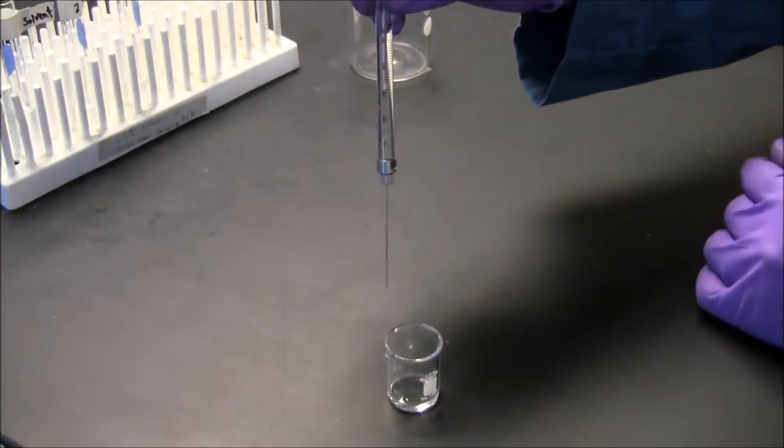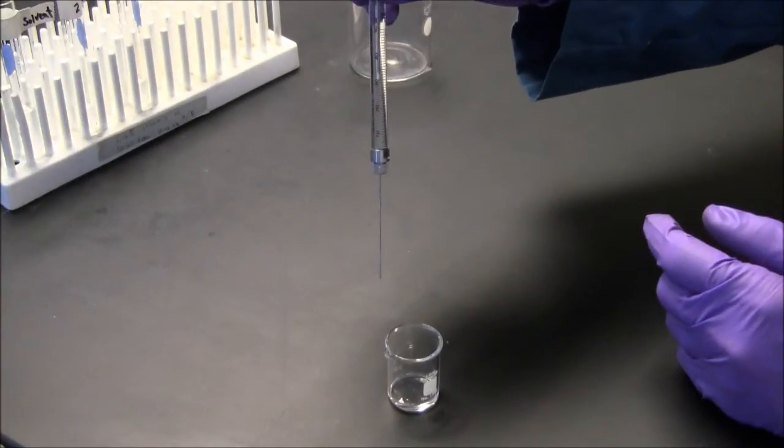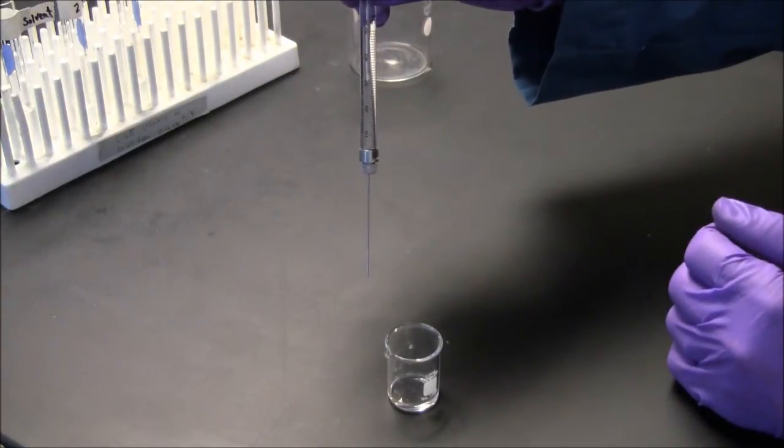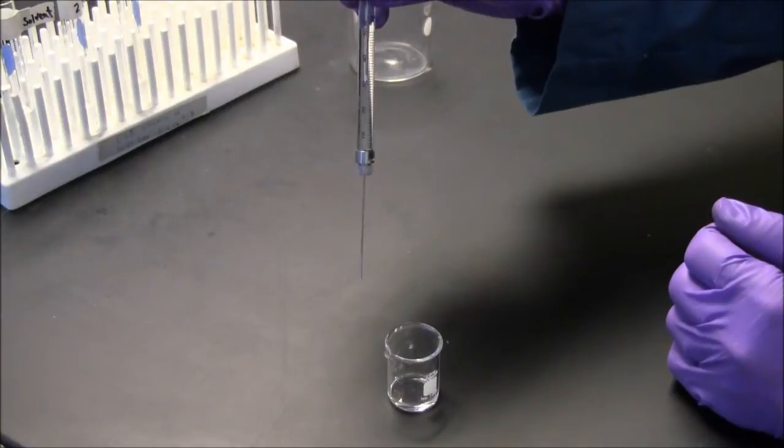The syringe won't drip. This is methylene chloride, but it doesn't drip. So this is the advantage of using the syringe over a micropipetter.